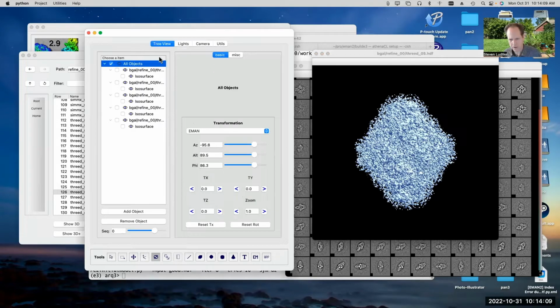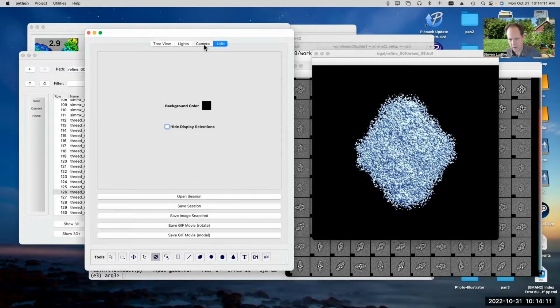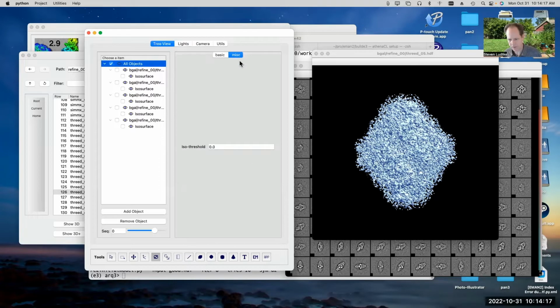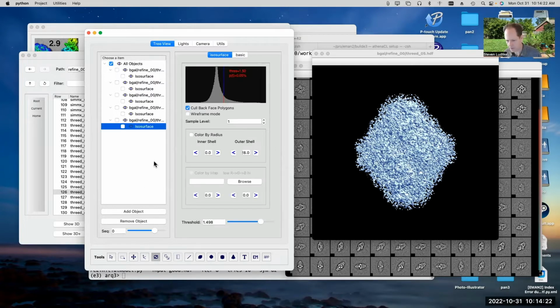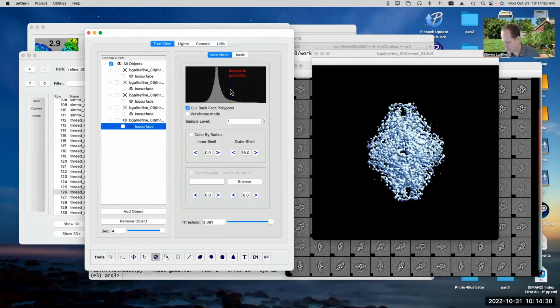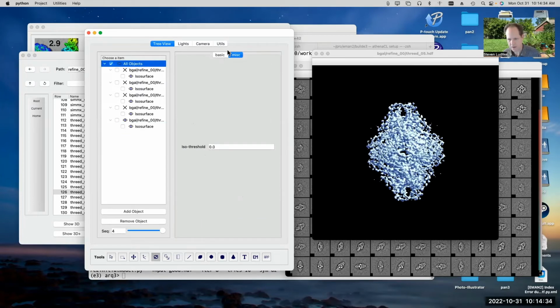There is an option, I think if I pick all objects and utilities, no, not all objects, right? Tree view, oh, there we go, miscellaneous under all objects. You can pick a single value for the ISO surface threshold and it'll adjust all of them to be the same. So we can look at just one of these, the last one, and pick a good ISO surface threshold for it, maybe about 3. Then I can go back to all objects here and type 3. Now they're all adjusted.